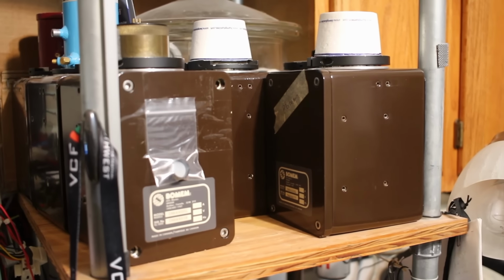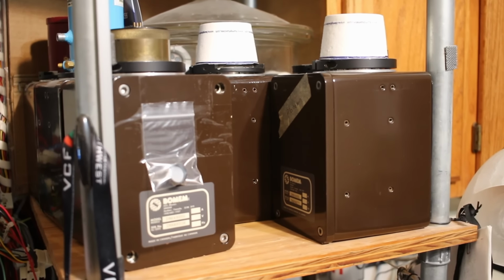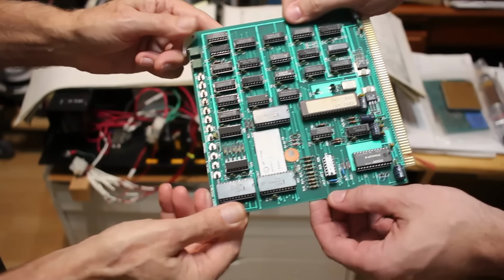So the new feedback resistor is double the old feedback resistor, which is why we're seeing double the amount of gain. Once back home, we'll solder the cover and RF shield back on, and I bet this ADC will be as good as new. But with that, we had just one last thing to do. Grab that replacement motor control board, and then it was back onto the road, keeping my eye out for deer, but otherwise just enjoying the night drive in the Cedric.